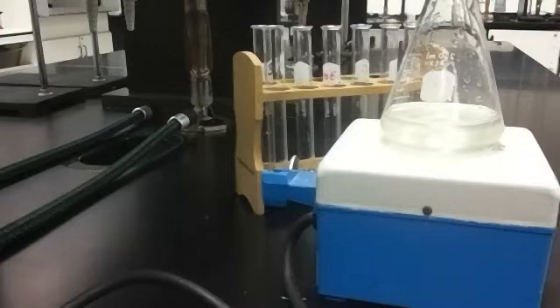Well, that's significant because iodine is something that will form a complex with starch that creates a color change. So we are going to add some starch to this reaction, and when the iodine gets to just the right level, we should see a sudden color change. We're going to time how long that takes to take place, and it allows us to measure the rate of the reaction. So they talk through how we're going to be adding sodium thiosulfate, which is something else that's involved in the reaction.